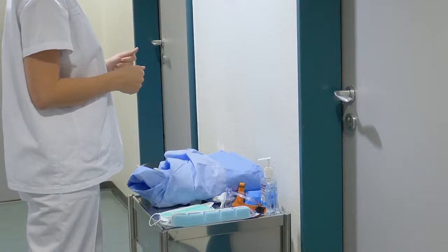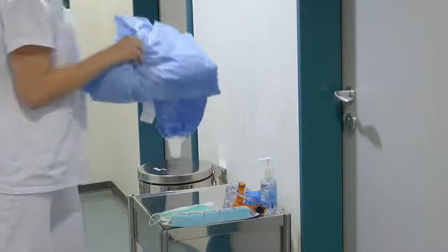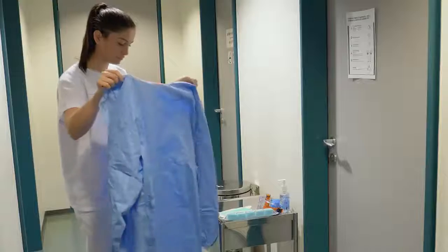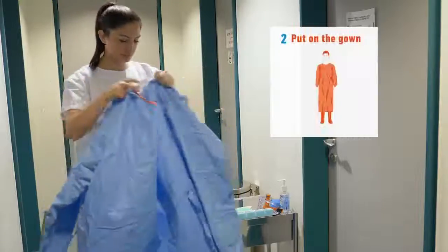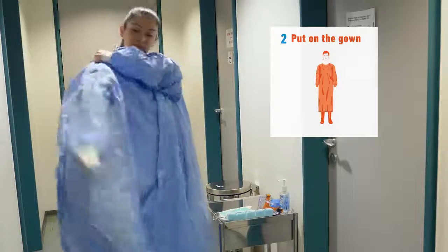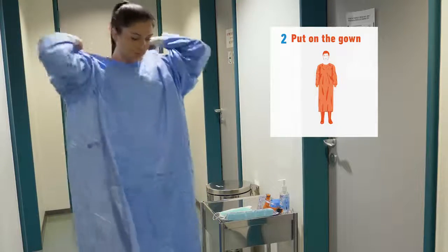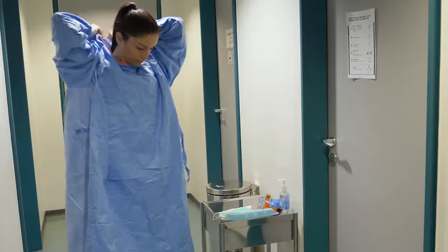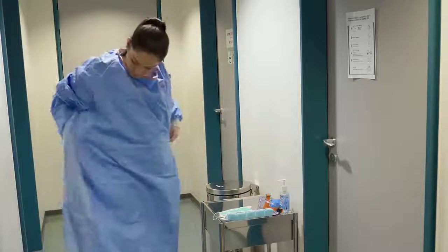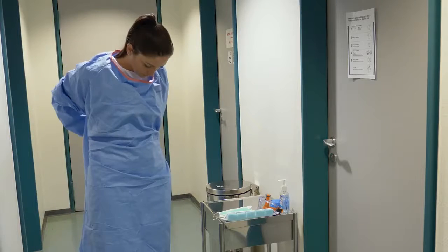So now that you're ready to put on the equipment, check the integrity of the equipment and do not use any damaged equipment. Now you're ready to put on the gown, so tie back the long hair if applicable and inspect the equipment for damage prior to putting on each piece. Put on your gown, tie it around the neck and the waist and secure it around the back. Ensure all clothing is covered by the gown.